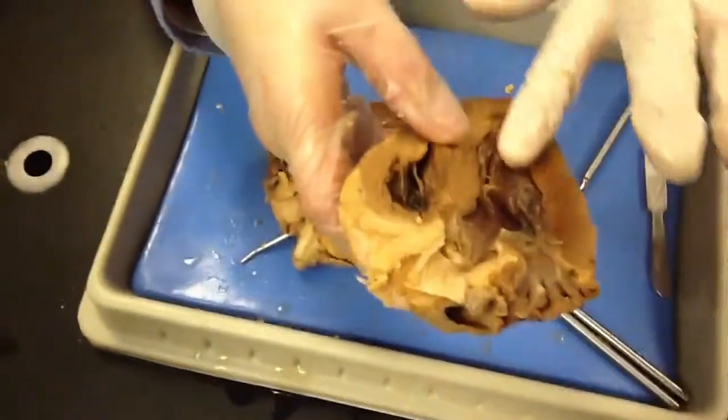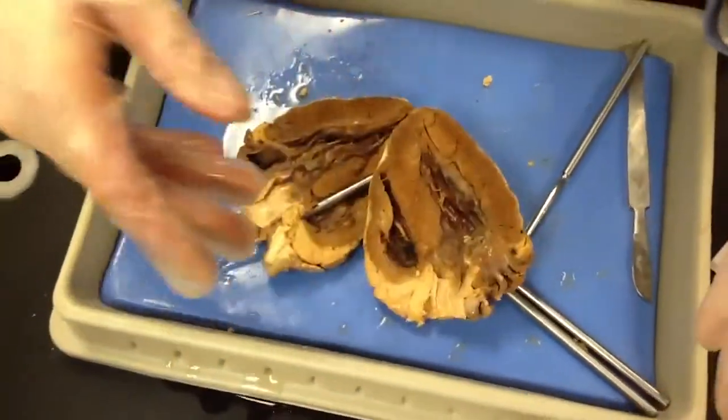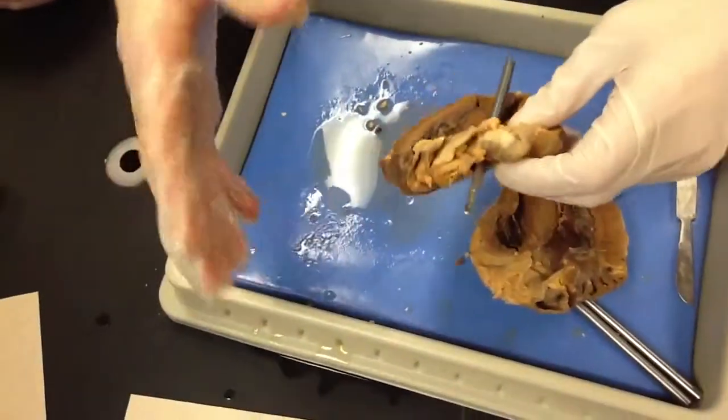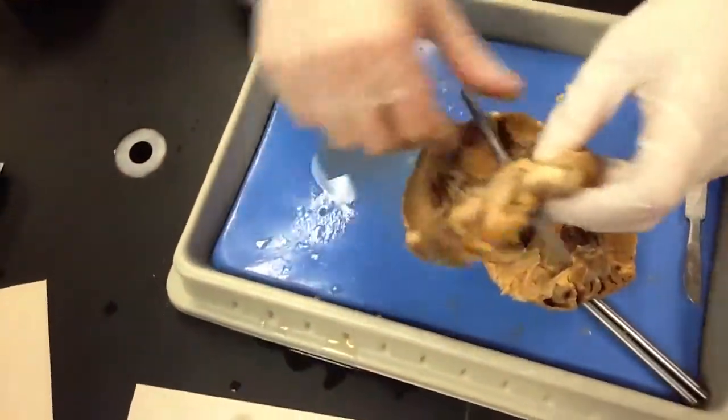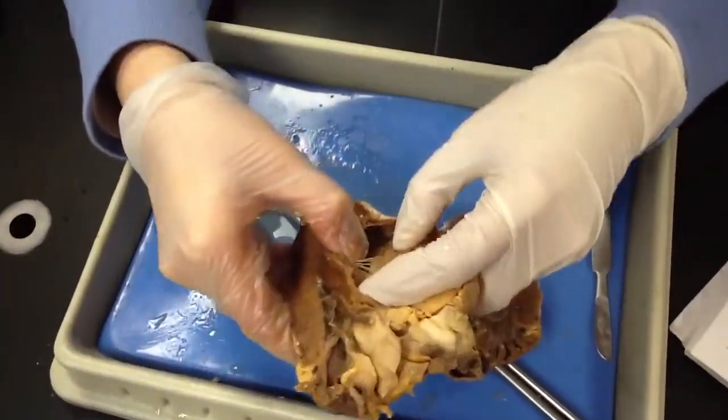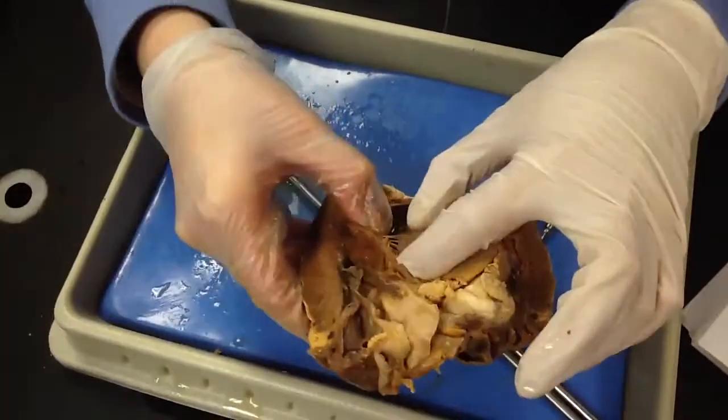Okay, so now where were we at? I'm sorry, I lost track. We're looking for the left ventricle and the arteries and the vein. We were talking about the difference between the ventricles and the atria, being able to see them, right? So basically, when you're looking for them, make sure you pull it apart. You're looking for the tendon. You're looking for those flaps. Do you see that?